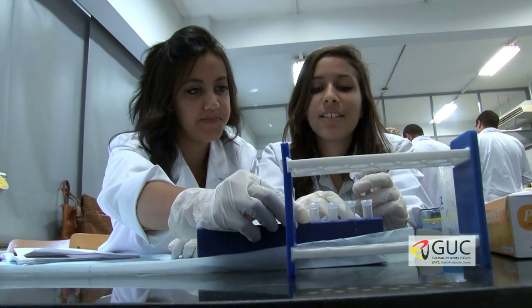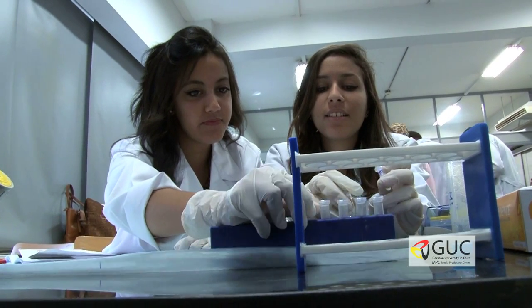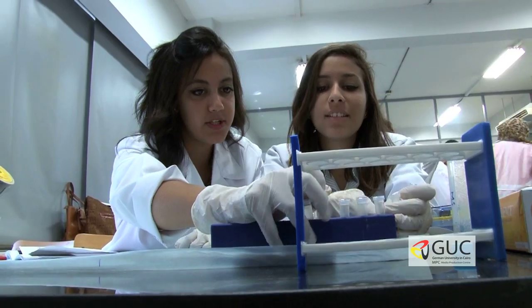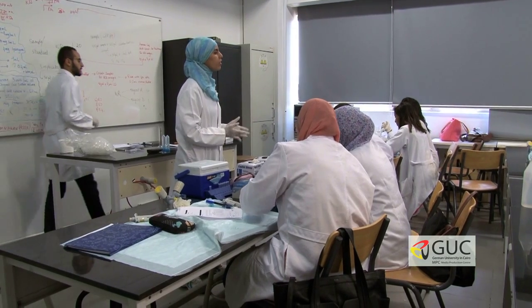The course aims at boosting the molecular biological skills of pharmacy students who will be using these techniques in the future, we hope. It begins with gene expression and protein purification.